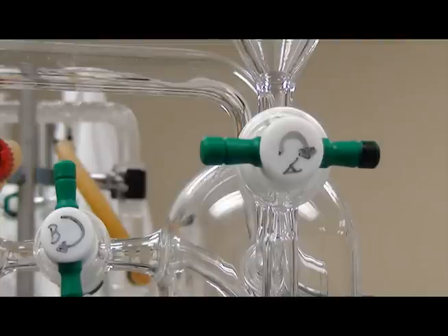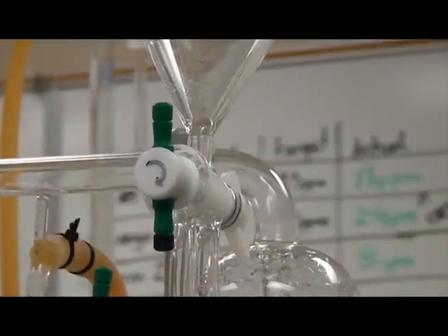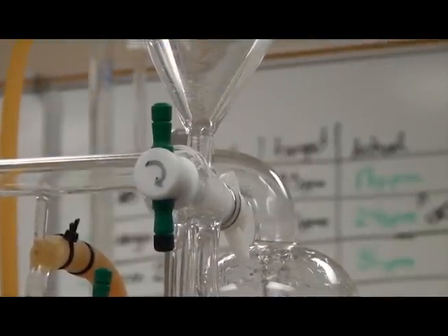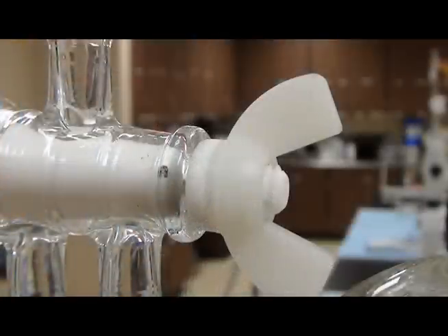There are two stopcocks on the still. One is used to fill the outer and inner sample chamber and is labeled A. The other is used to aspirate the sample chamber and is labeled B. These stopcocks should only be turned clockwise, in the direction of the arrow, to provide consistency when filling the chambers. Also, if turned counterclockwise, the nut on the back can come unscrewed. Periodically check the inlet and aspiration stopcocks.